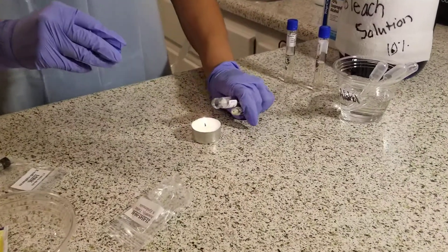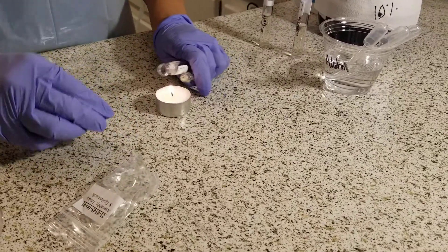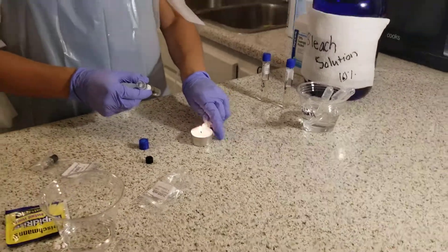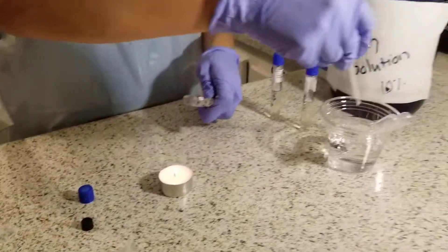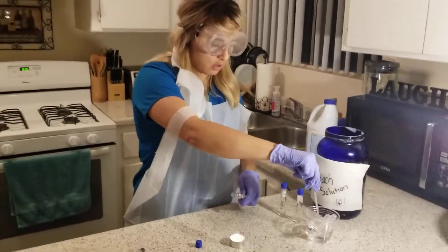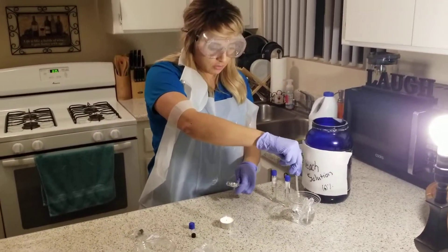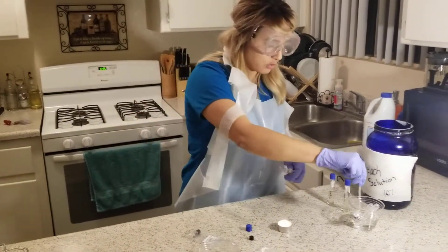Make sure that both tubes are tilted and sterilize the tips of the tubes so that there's no contamination. I'm going to use the pipette again. Make sure all the alcohol is out of the tube. Then with the tube, I am going to go into the culture vial.